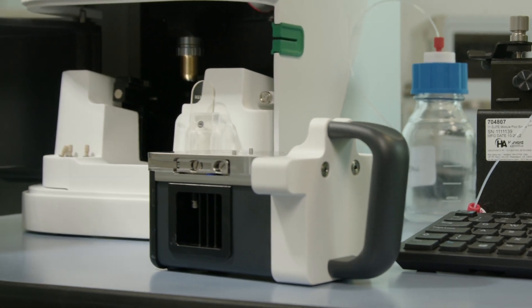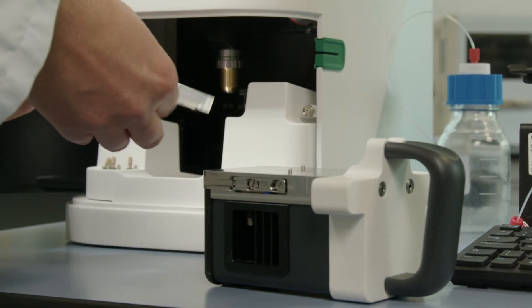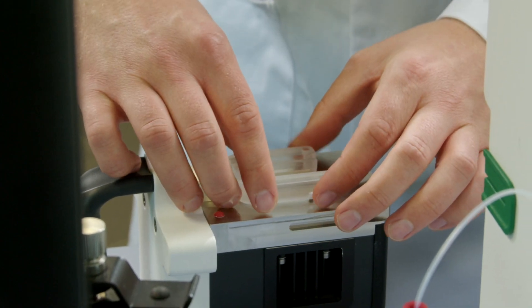Inside we have the bits we need to put on. We've got a holder inside the instrument for the low volume flow cell so we can now put this on top using these guides.